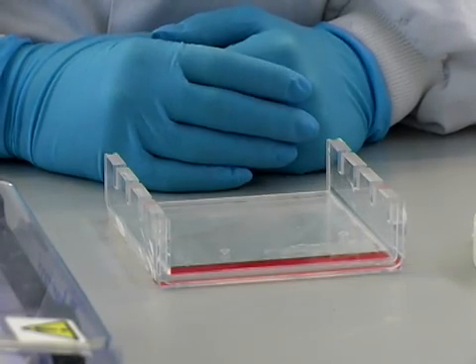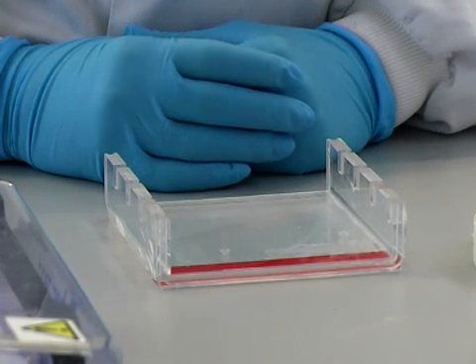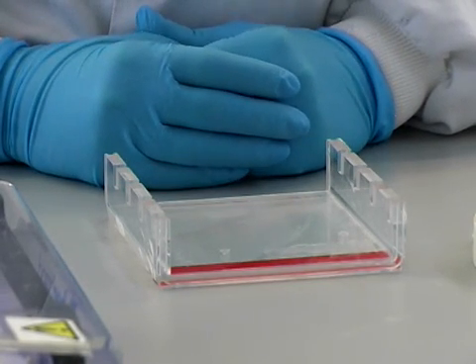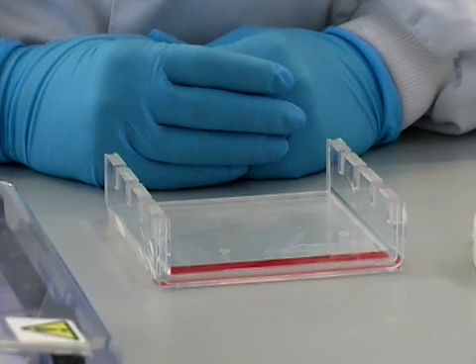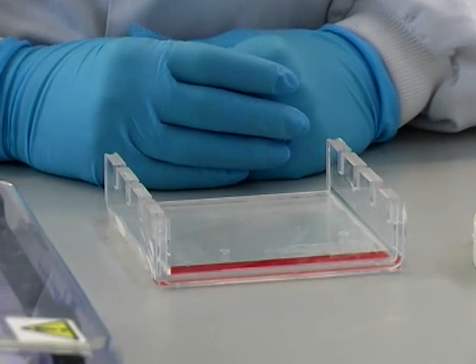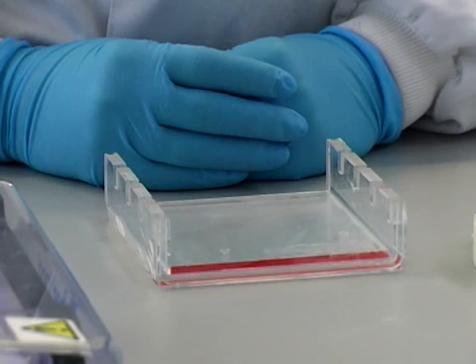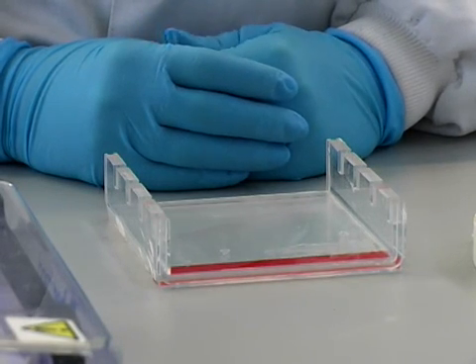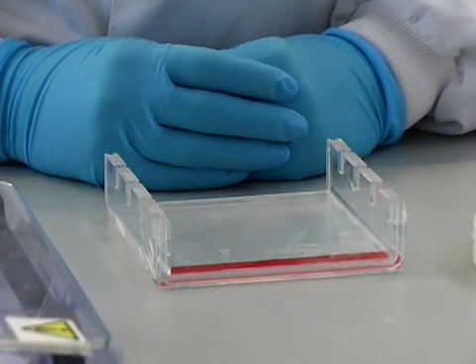We're now going to perform agarose gel electrophoresis. Electrophoresis is a technique used to separate molecules based on their charge and size. An electric current is run through a gel and the samples move along the gel depending on their charge.